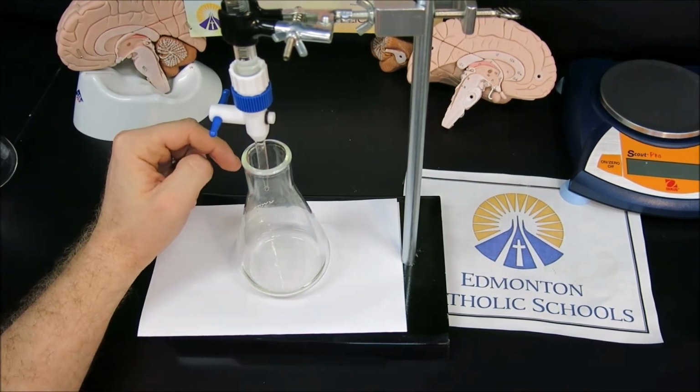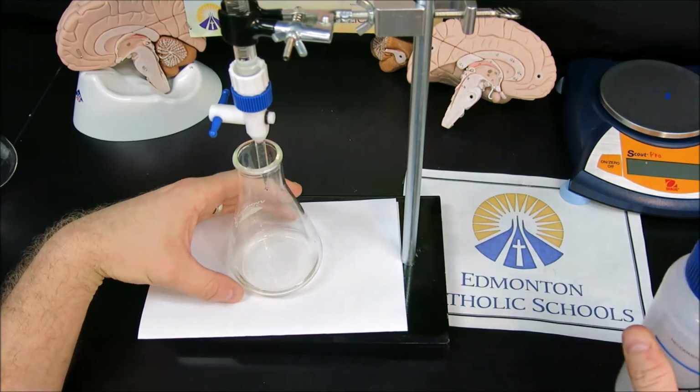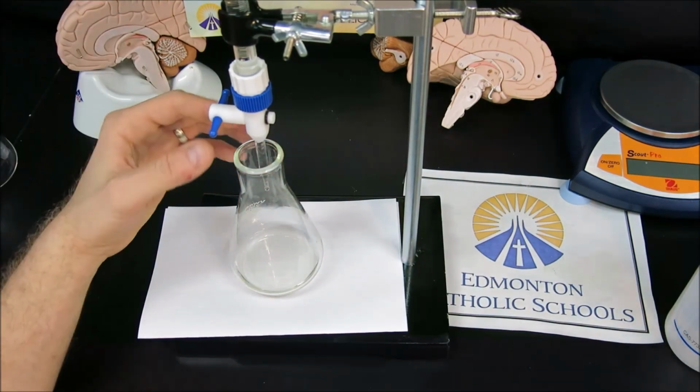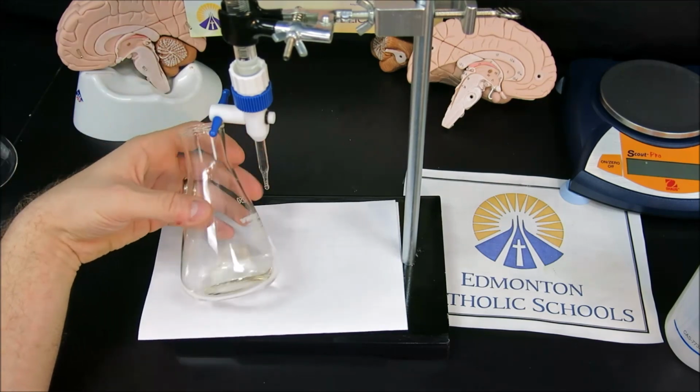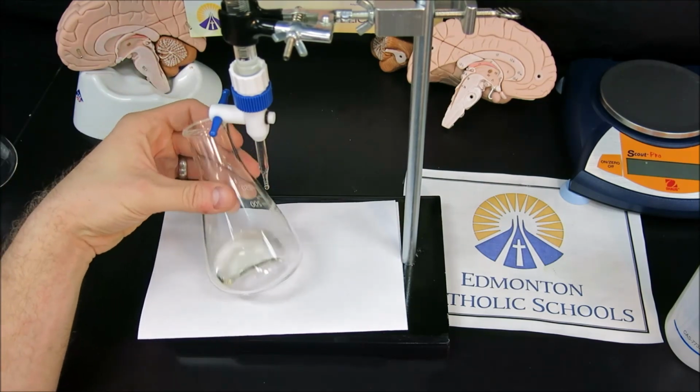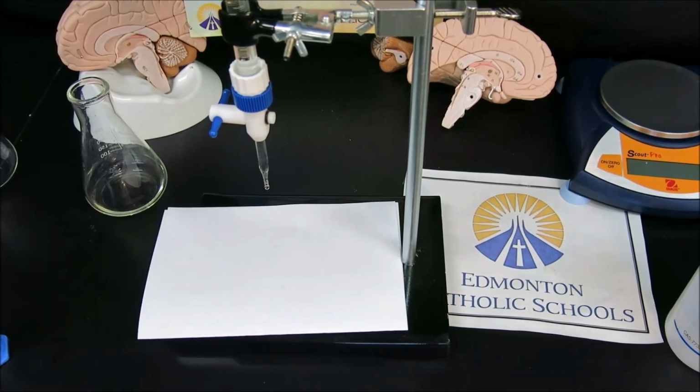Now we can see there is a small drop hanging off the tip. That must be included by a small squirt from a wash bottle, because that has actually left the burette already. It must be counted as volume. So now we have a color that is yellow, and that is going to be considered our overshoot. We will again take the camera and zoom in on the volume.